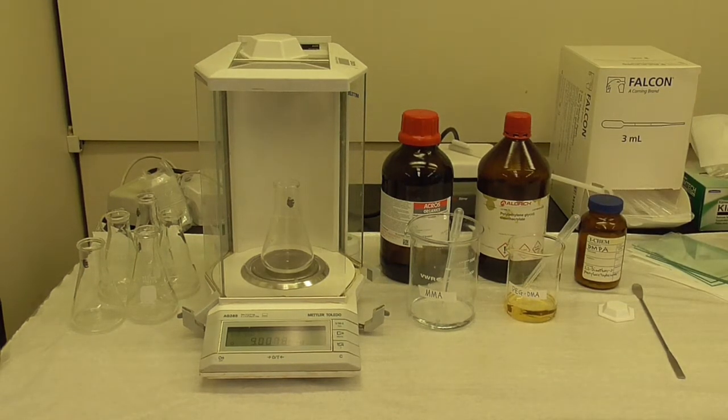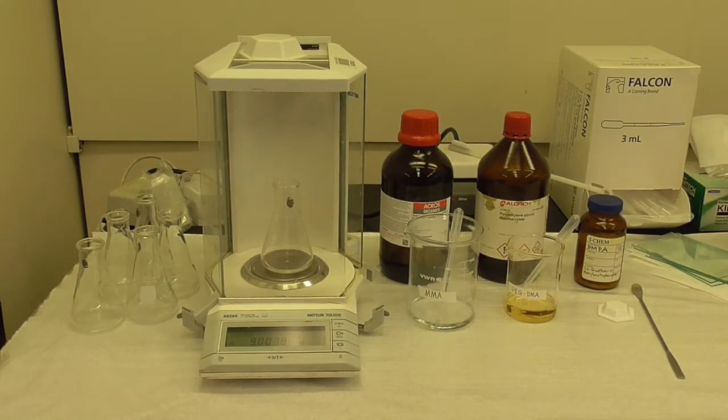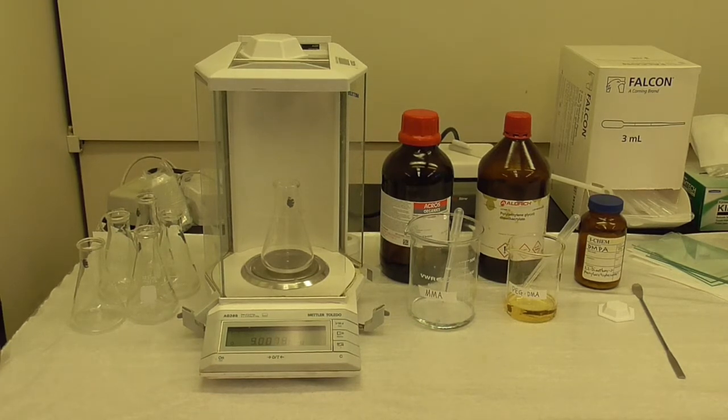I have nine grams of MMA. Notice the sash is down over my face. I move it up for the video but when you're working in the hood, you want to be sure you're looking through the sash.